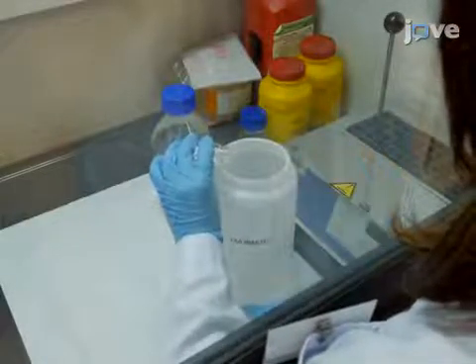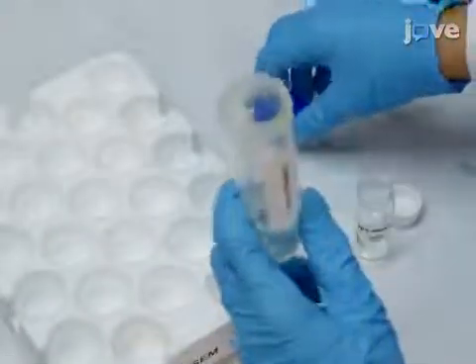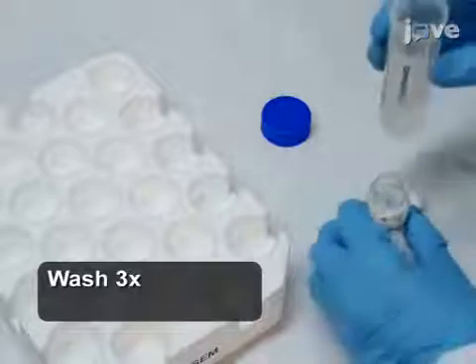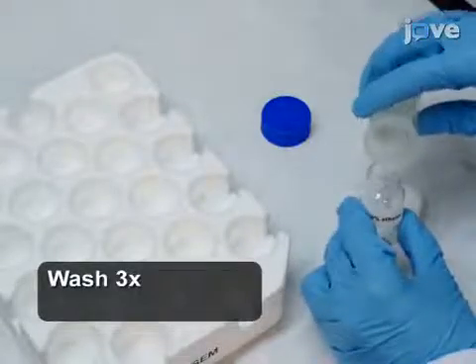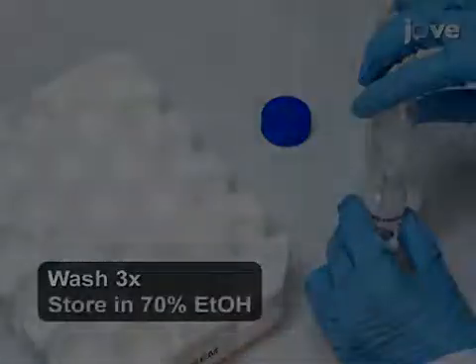After 72 to 96 hours, pour the FAA into a plastic container for chemical disposal. Immediately wash the samples three times with fresh 70% ethanol to remove any residual FAA. Fixed material can be stored indefinitely in 70% ethanol.